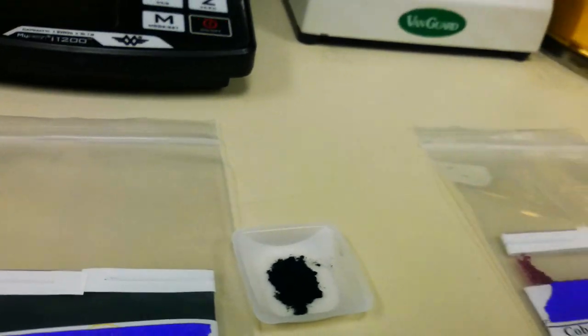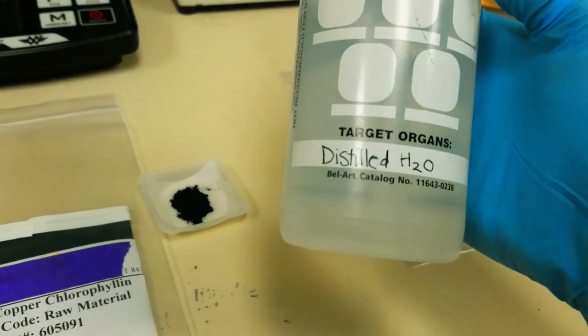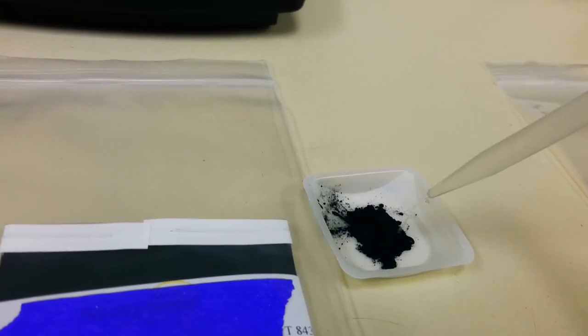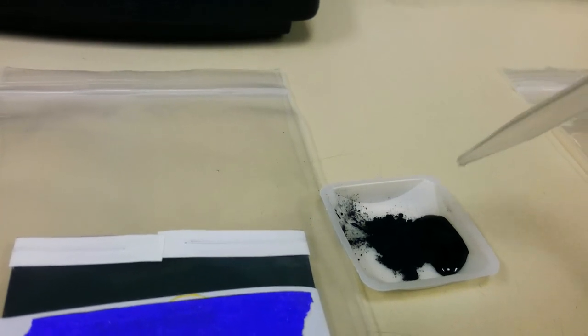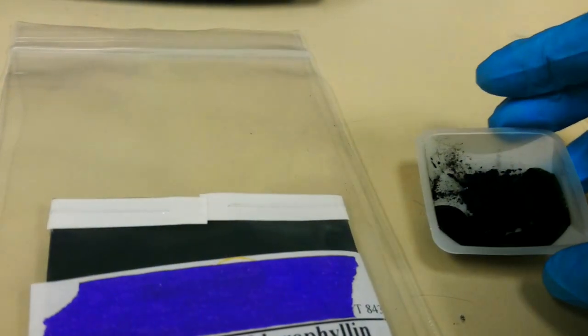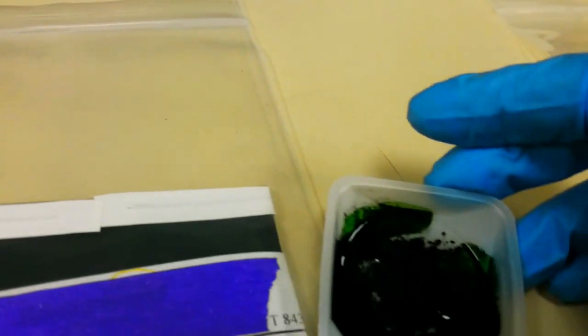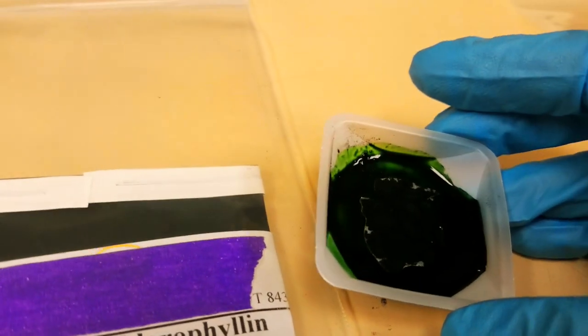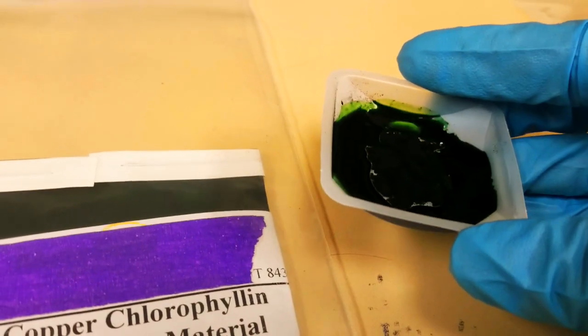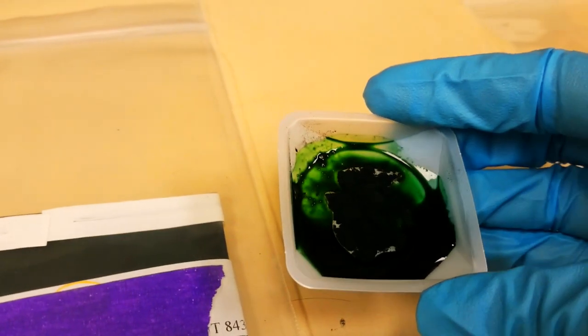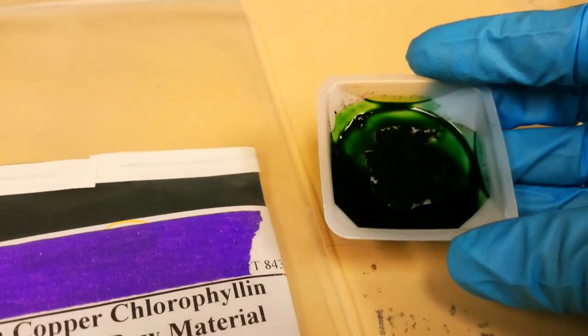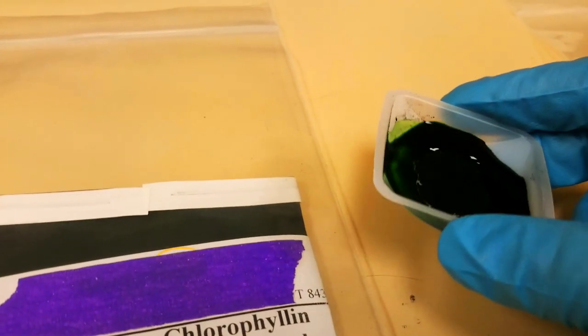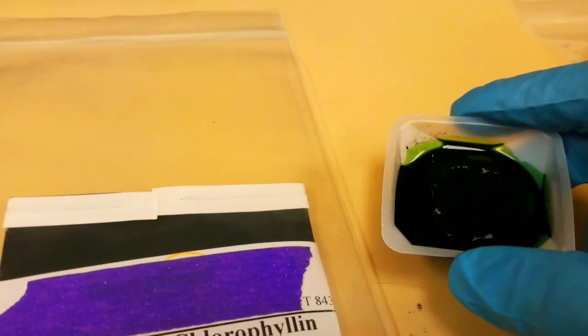But when you add water—this is distilled H2O—it turns this vibrant green color. I think it's a really beautiful shade of green. And I love how dark it is.